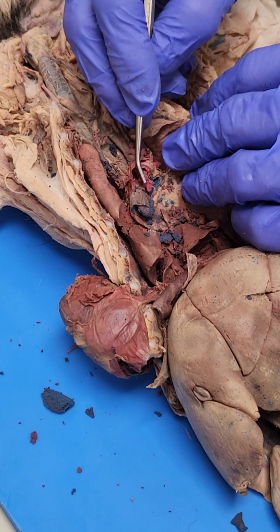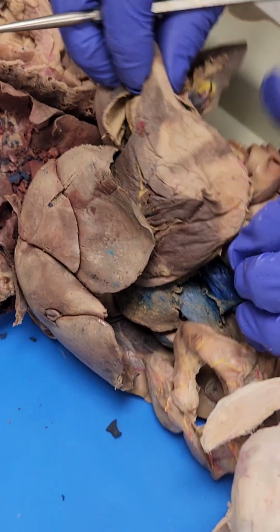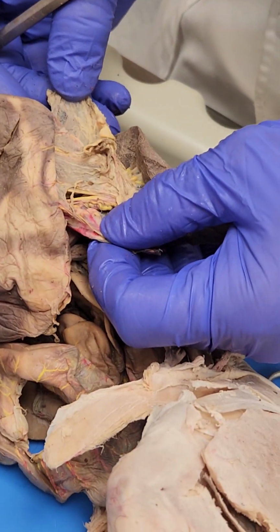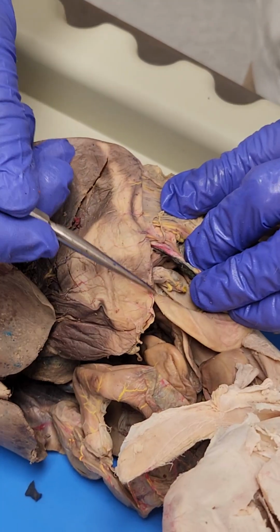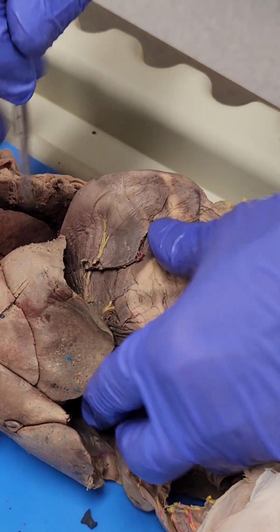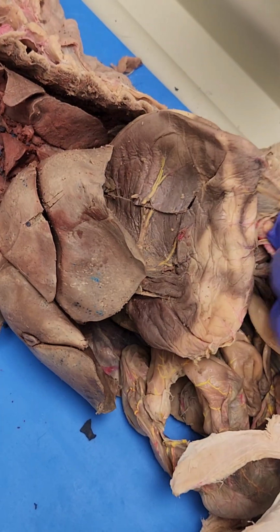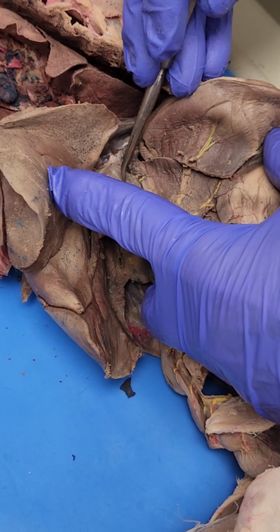It's sort of a vague area. This is the stomach, and then hanging off the stomach, that would be the greater omentum. Greater omentum hangs off of it, and it hangs off of the greater curvature. Did we have to know that greater curvature? I think so. Okay, and then the lesser curvature is up cephalad, or in the cat anterior, and that would have not nearly as extensive, but that would have an omentum there, and it's called the lesser omentum.